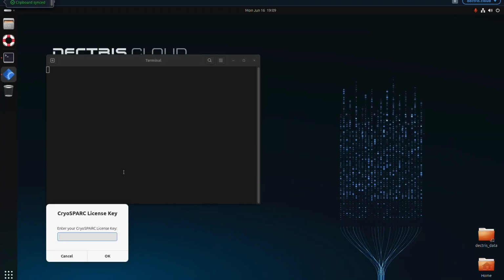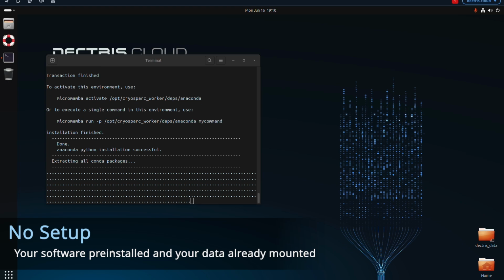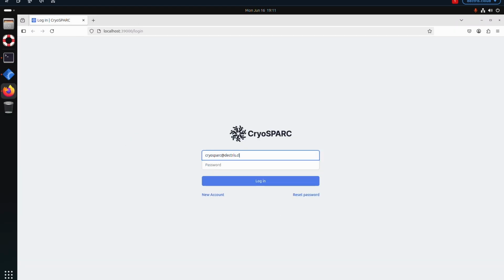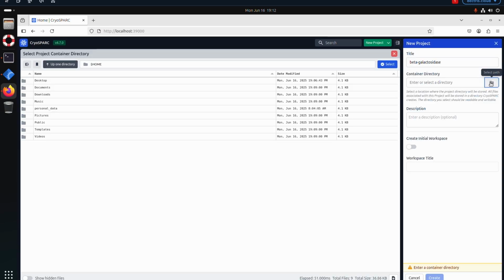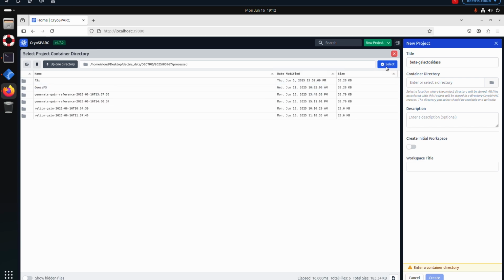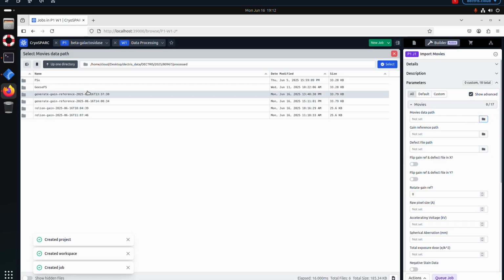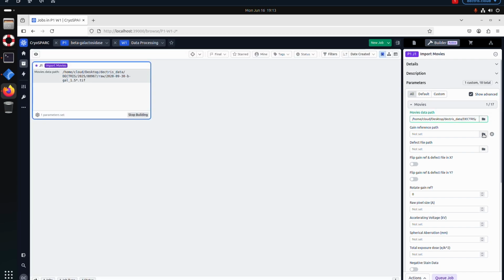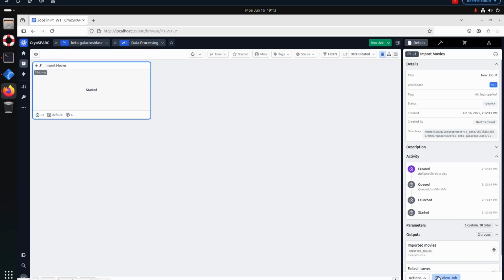In the case of the CryoSPARC environment, it will prompt you for your license key, and once you give it to it, it will set everything up automatically. Once CryoSPARC opens in the browser, you can simply log in and go about your project as you would normally do using CryoSPARC. You can always find your mounted data under /DECTRIS data, the year, and then your project identification numbers. And then we can import the movies straight from the raw folder, which contains all our TIFFs. The gain is the result of our job, which we find under the processed folder.